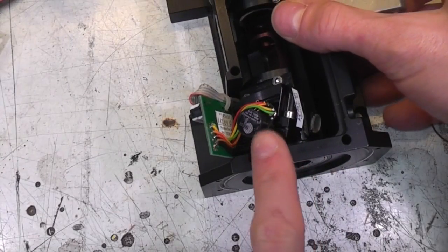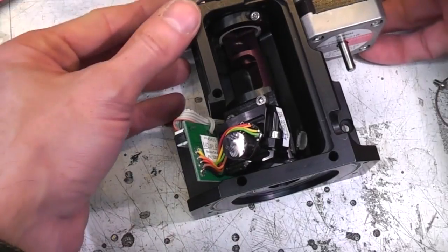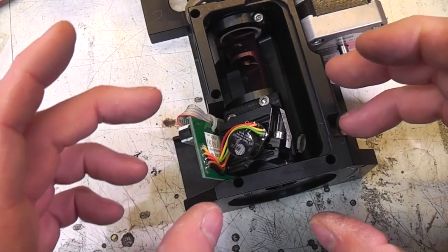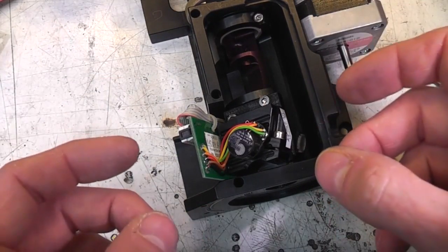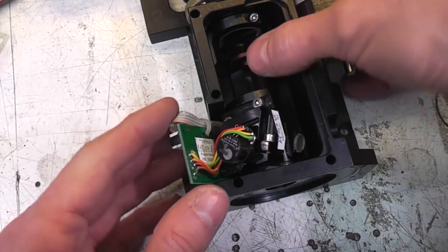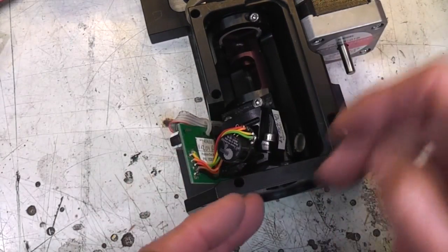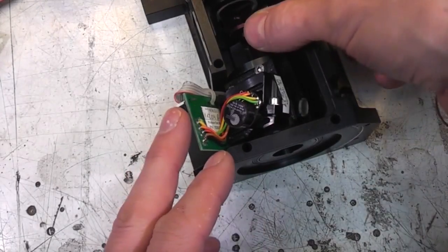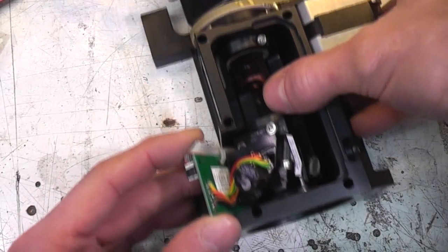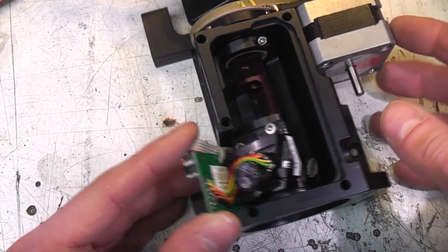Now there's another, I'm not sure if this is an actuator or not. If so, it could well be that these two galvos give you the XY raster scan, and this rotation just provides a way of rotating that whole raster. Not quite sure why you'd do that rather than just rotating the sample on the stage, but I think that's the case. So we've got basically a rectangular scan. Bear in mind, of course, because these are scanning small samples, the actual amount of scan is going to be very small, because we've got, you presume, some distance between this and the sample, but obviously you're scanning very small samples, so it's probably only scanning like a millimetre or two range. So I'd imagine when it's running, this probably sort of moves only a very tiny amount to produce that scan.